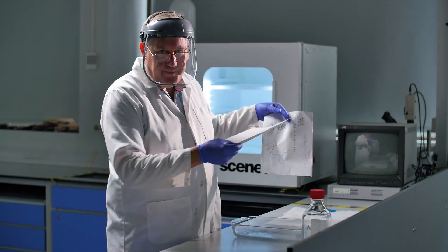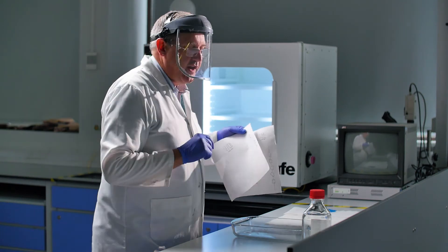And I think we're ready to go actually. So I'll move over to the oven and place them inside.